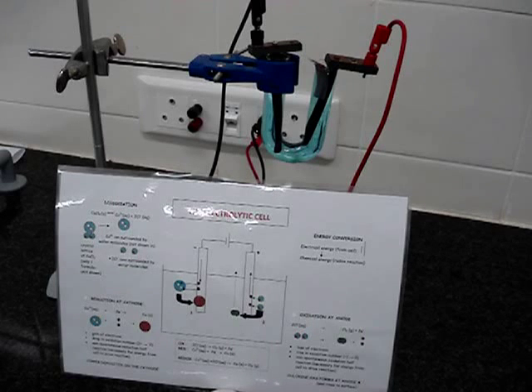And it doesn't just conduct electricity. It also allows a redox reaction to occur. Let's discuss what is happening here, and then we'll see the results.